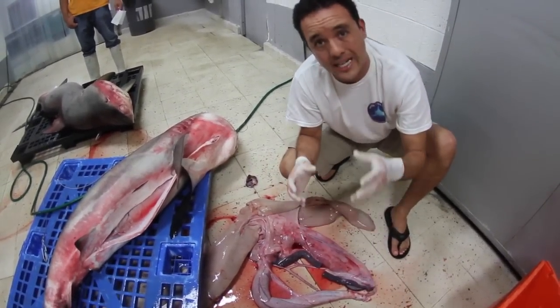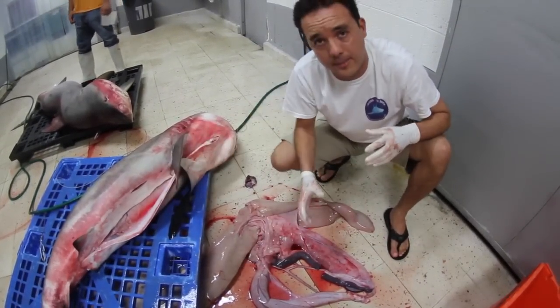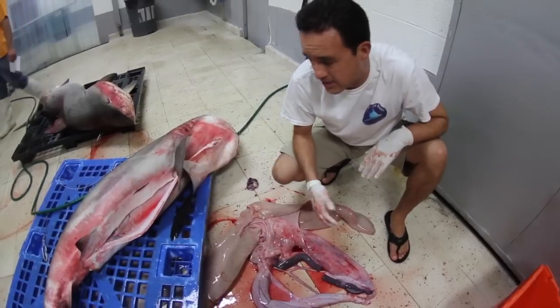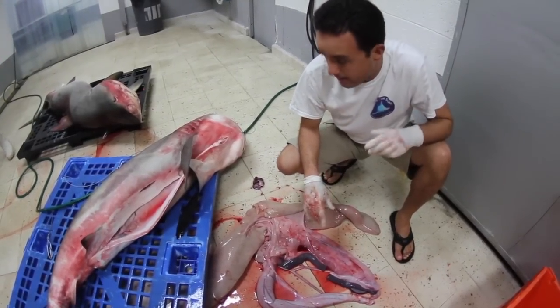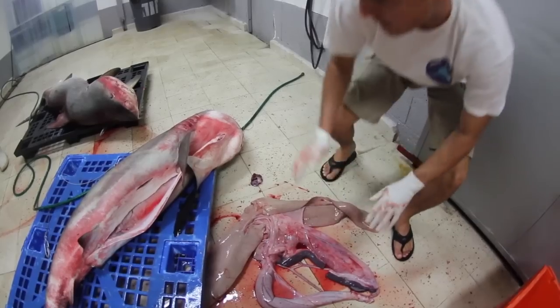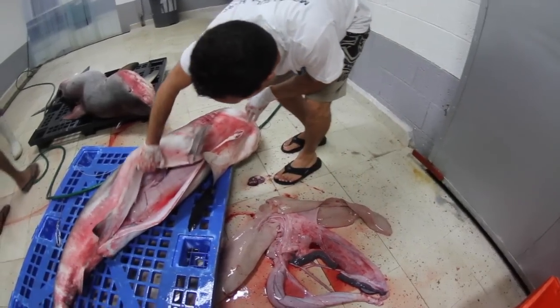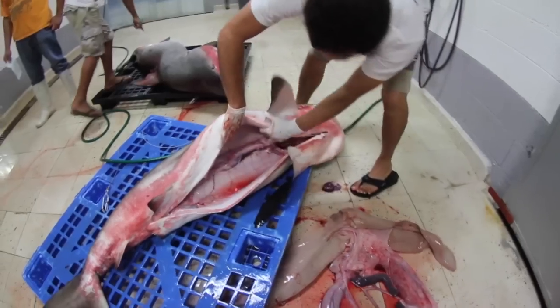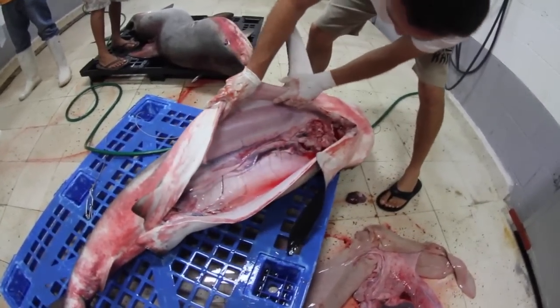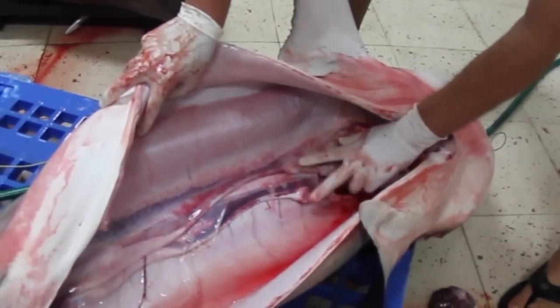At the end the intestine is connected with the rectum and directly with the cloaca. Here we have the excrement, the urine, and if it is a female, we can see the female reproductive system. This is the nidamental gland — the oviducal gland.